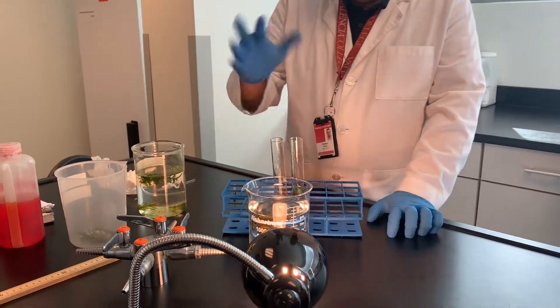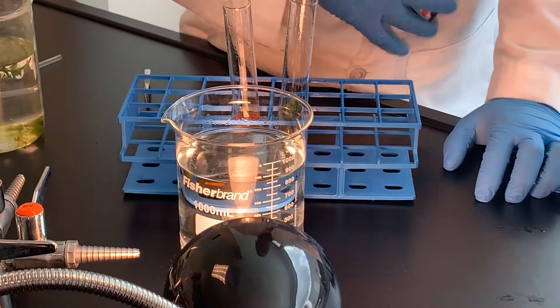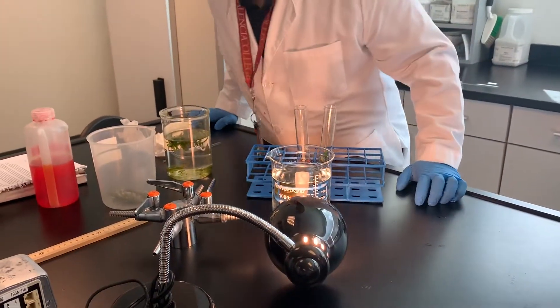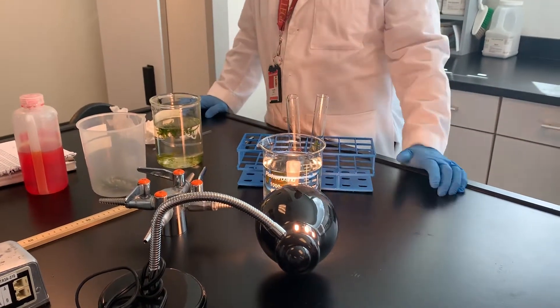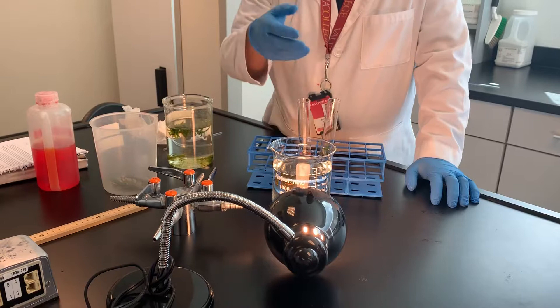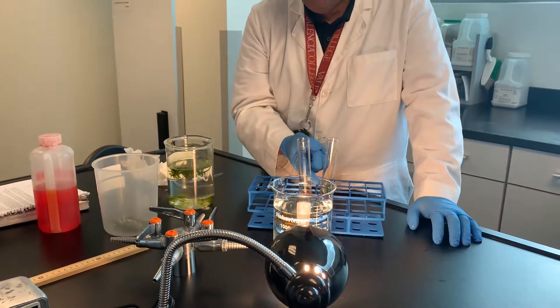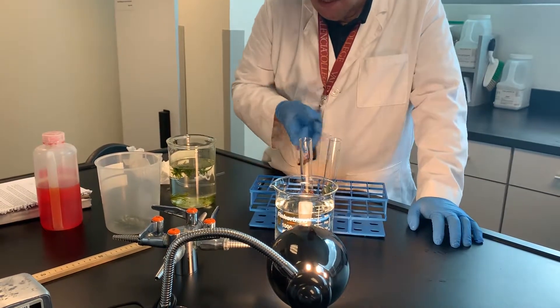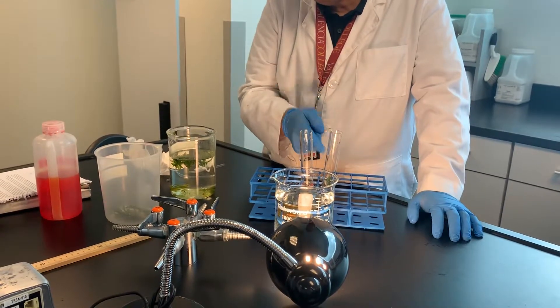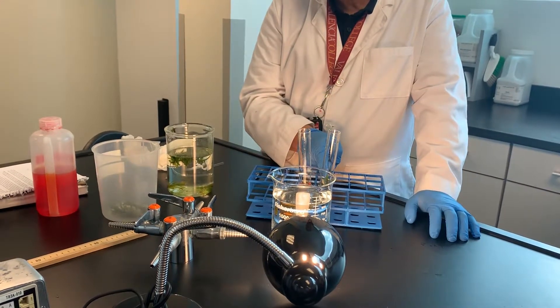What's your prediction? After about half an hour, what color will the tube with the plant become? Red — it'll turn back to red. Why? Because the plant is consuming the CO2. The CO2 I put in there caused the solution to turn yellow, but now the plant is using that CO2, so the pH goes back up and the solution turns back to red. Our prediction is that if this plant carries out photosynthesis, the color of that solution should turn back to red.